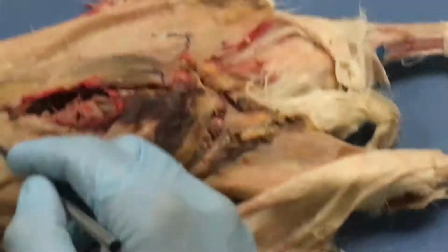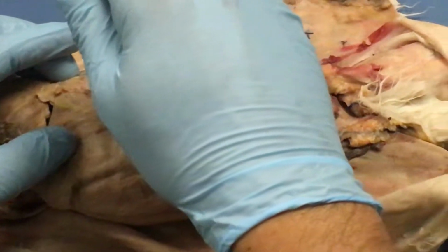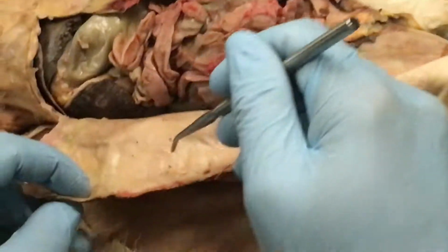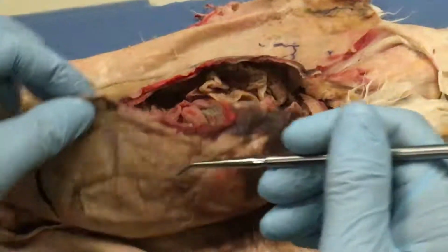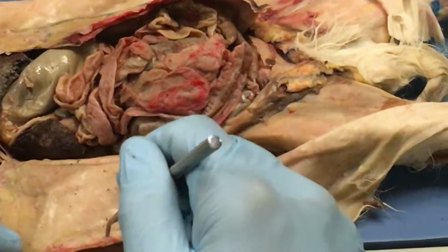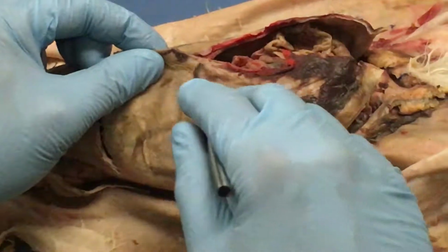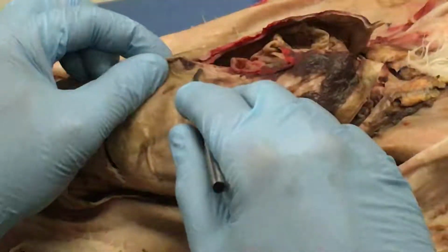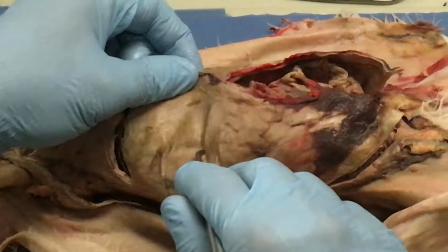Now two of these muscles we just really can't even see. Okay. The rectus abdominis is here. If I have a pin on the outside right in the middle, that's rectus abdominis. If I have a pin on the inside right in the middle, then that's transversus abdominis. Okay. We have external obliques, internal obliques. So if I'm in the middle, I'm not looking for obliques. If I'm over here, I'm looking for obliques. But if I'm along this middle line right here, then I'm not looking for obliques. Okay. This is rectus abdominis, transversus abdominis, internal obliques, external obliques.